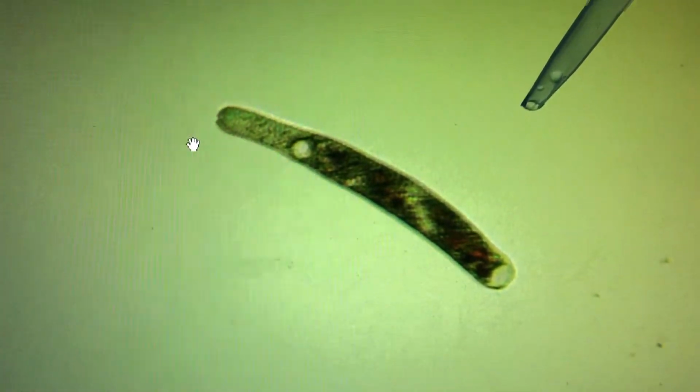The other thing I want to point out about this little parasite is the color in its cytoplasm. Very important. Have you ever noticed a green skeleton after it's RTN? We have plenty of them. Just about every single acropora that's RTN that I've ever seen, or other type of coral, goniopora, they have a green tint to their skeleton. I believe that green tint comes from these green particles inside the parasite. For some reason, it's got a green pigment to it. And you can see the older it gets, the bigger they get, the more green. The younger ones don't have this green pigment or dye.